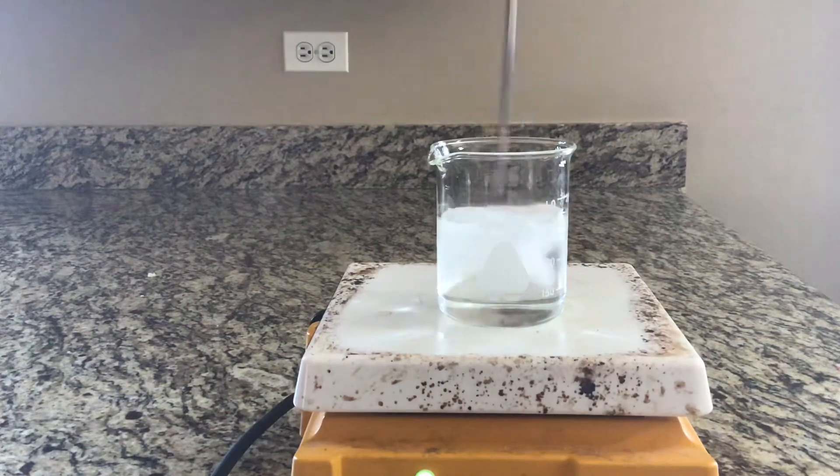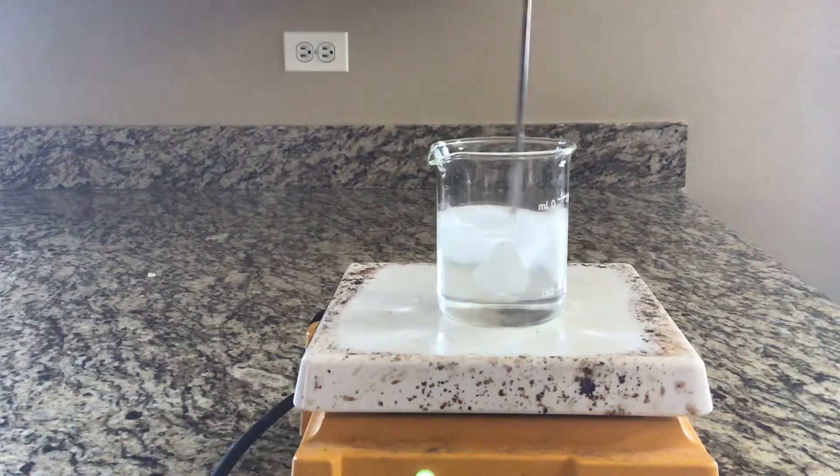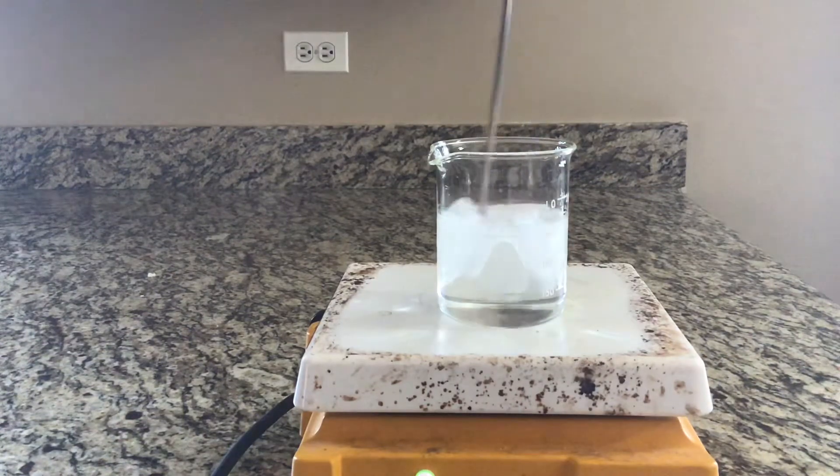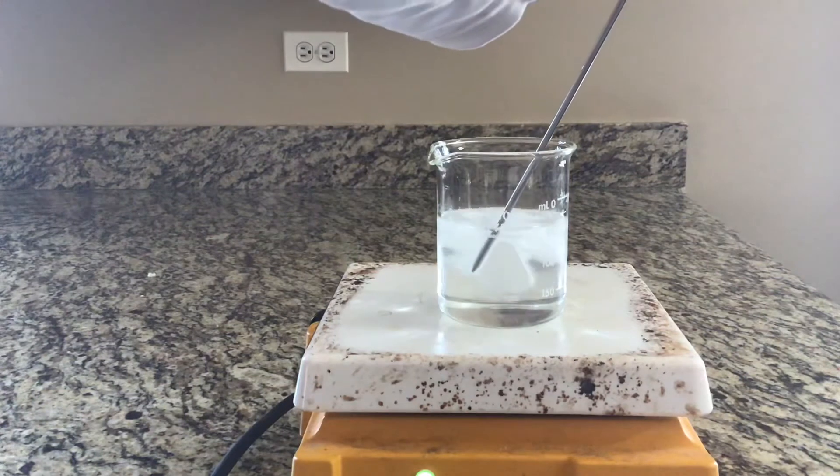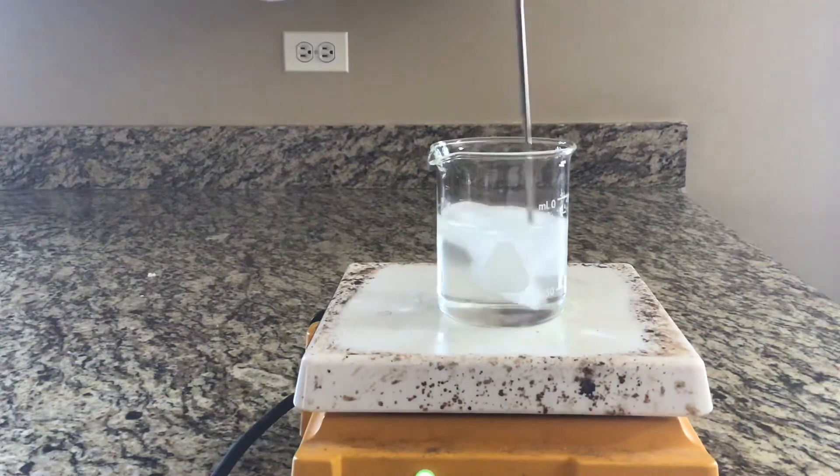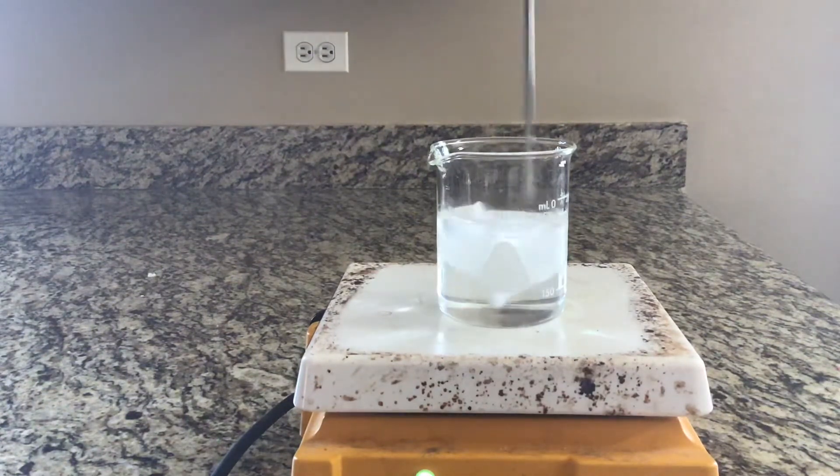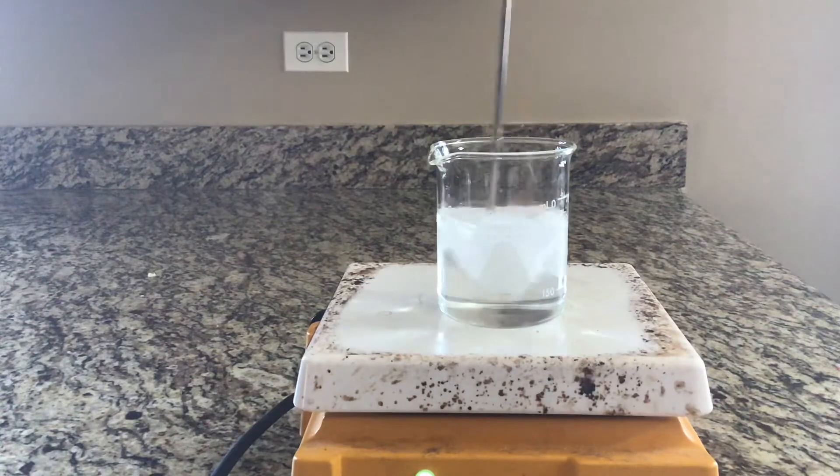There's still ice and water in there. Coming up on another 20, this will be 60 seconds total. The temperature is 3.9 degrees Celsius, currently the temperature of that water.